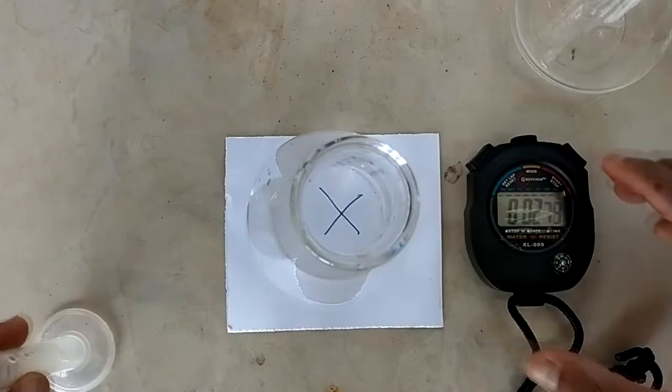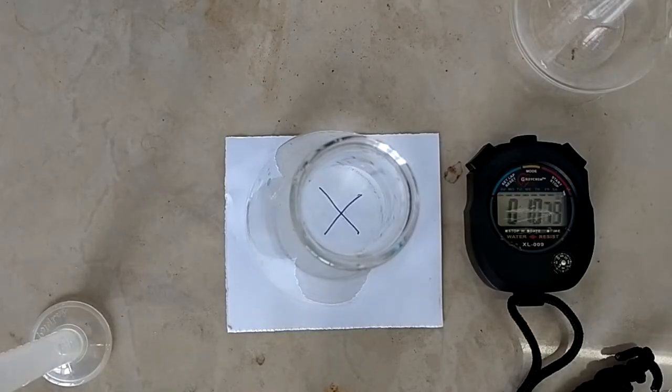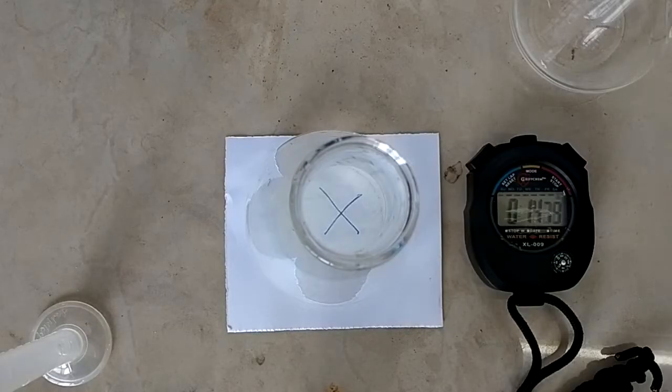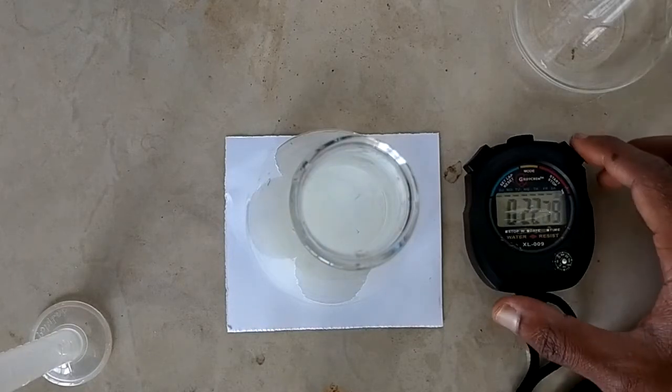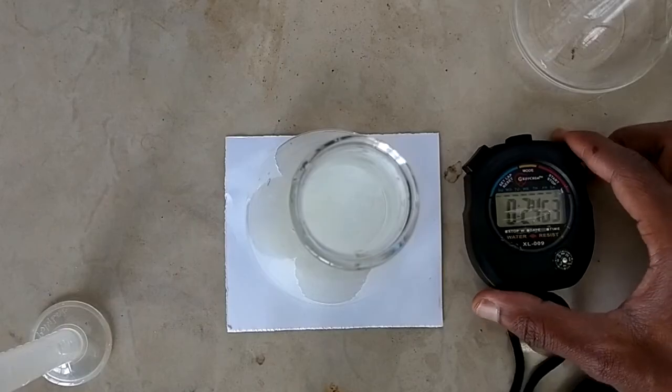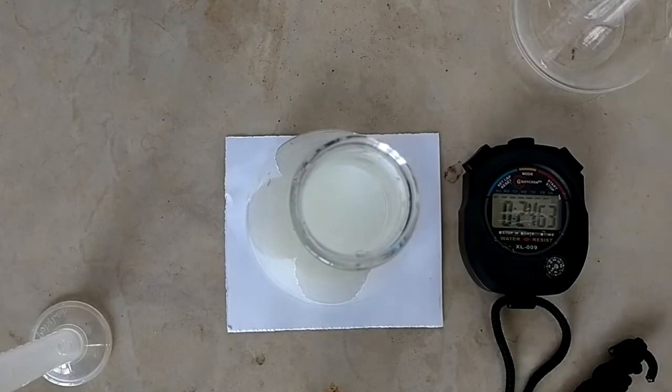Look at the cross. Note the time taken that will take for the cross to disappear completely, and you must be looking at it from the top not from the side. And there, 24 seconds.